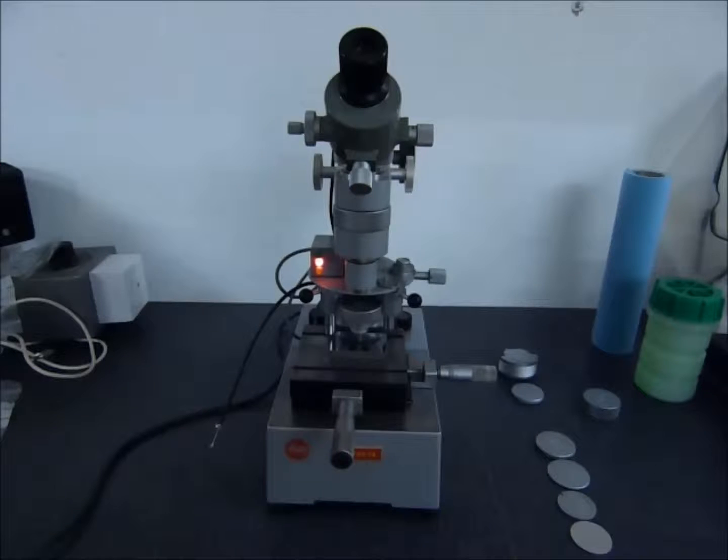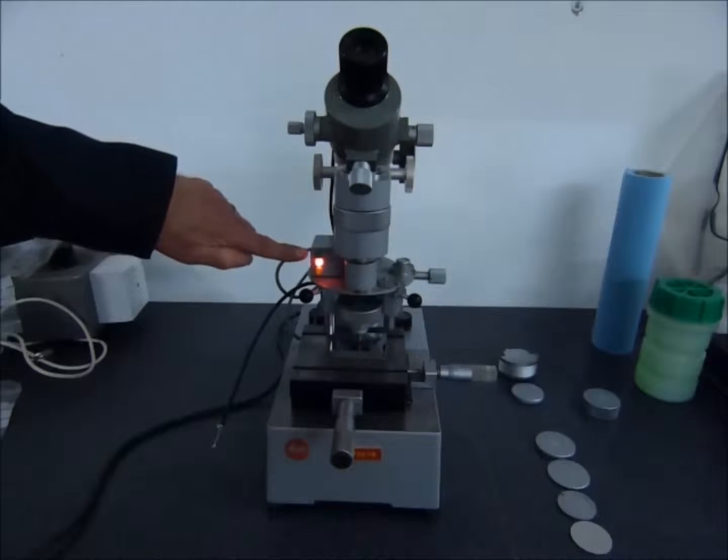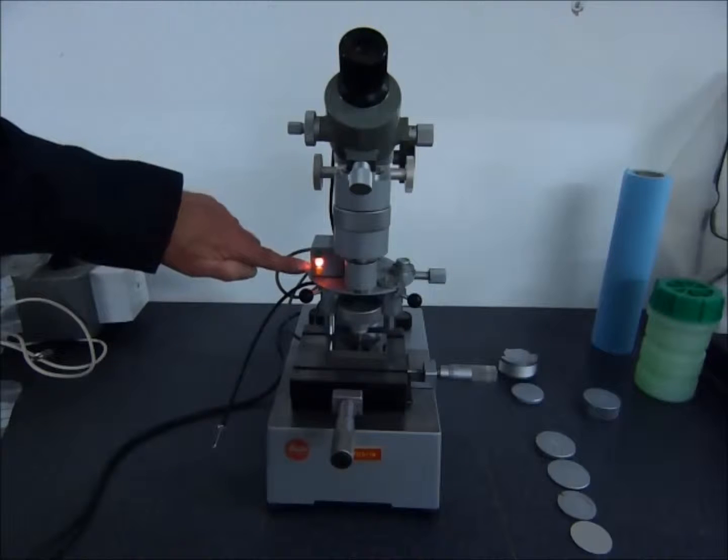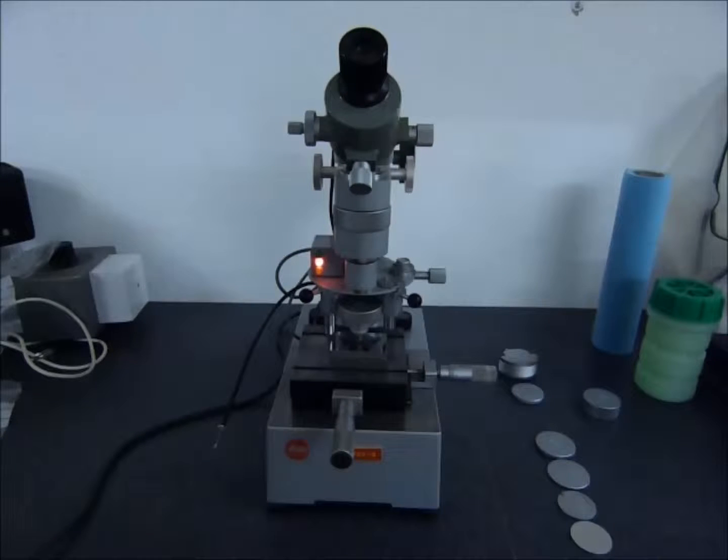Simply pressing the plunger, you will see that the cycle has started. The green light has gone out. The red light has come on indicating that the load and dwell time is in process.